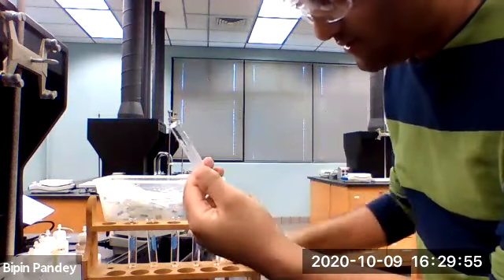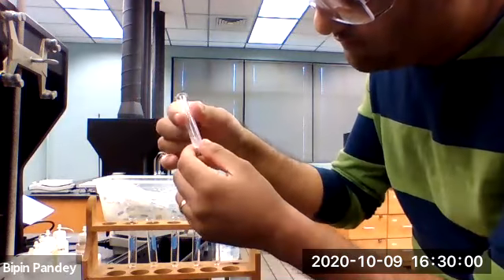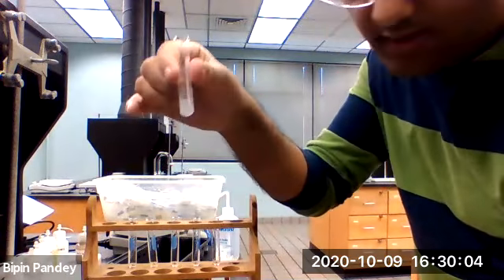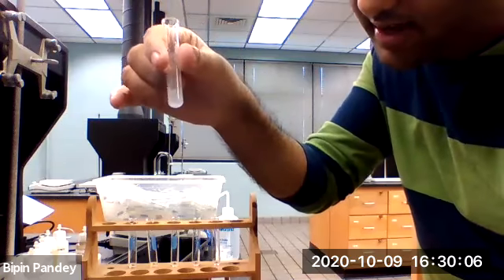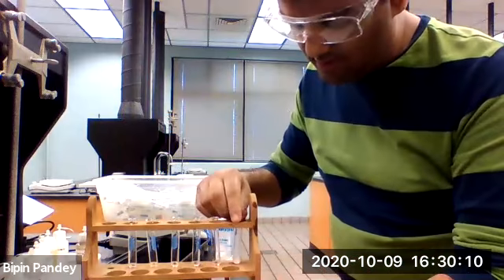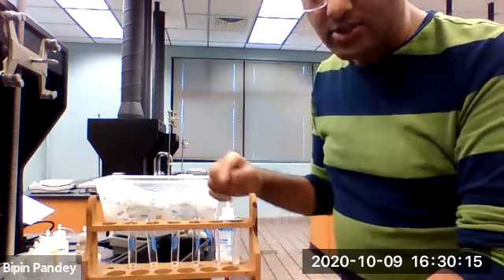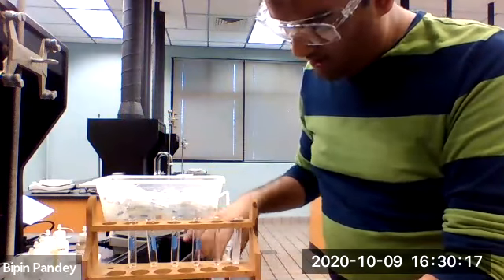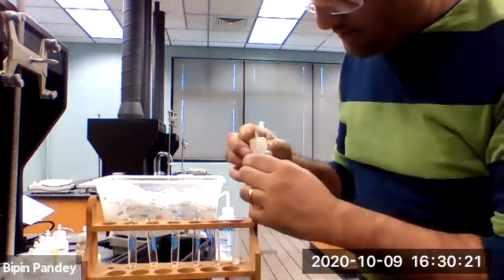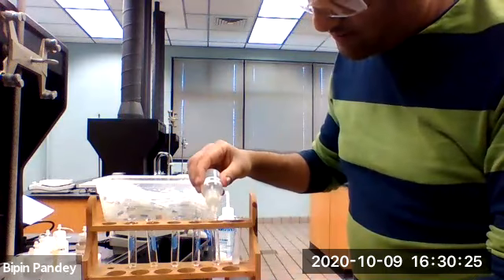Strontium sulfate seems not to be soluble. I see some gluey stuff like that. It looks to have a precipitate. If our unknown has sulfate and we add strontium nitrate, then it will have the same kind of behavior. So let's add the strontium nitrate to the iodide.